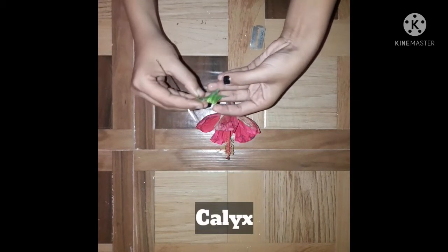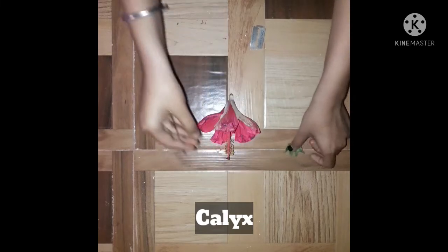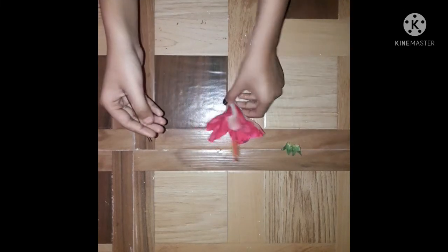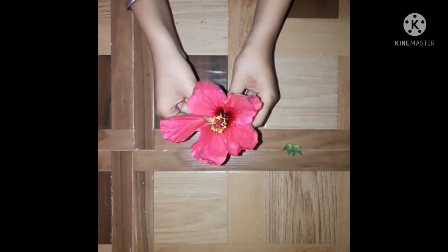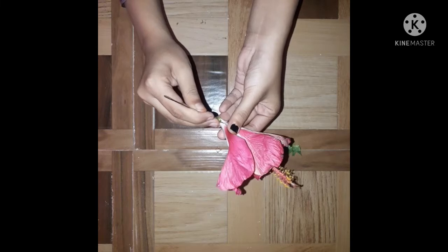Here you can see calyx is separated from its base. And now I am going to separate the petals one by one. Petals are collectively known as corolla.